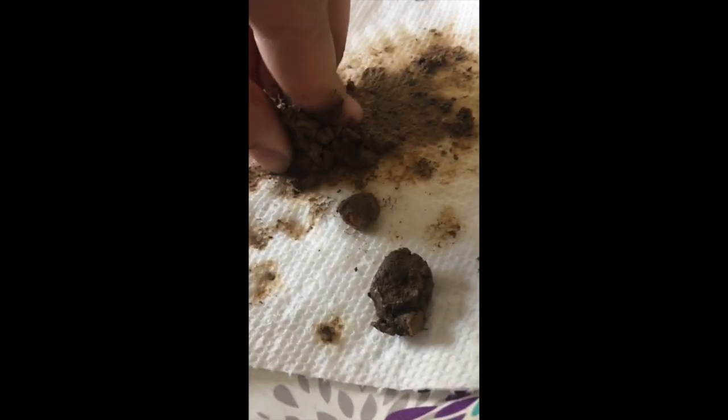Definitely more visible. Definitely is able to hold its shape a lot better and is more stable than it was when it was dry, before we put it wet. There's definitely a lot less slumping going on in both of these samples. Just being able to feel it, and try to do a little bit of ribboning with it, the soil mass definitely is greater with less slumping, and the aggregates are a lot bigger, a lot more visible, and the stability is a lot greater on both of them as well.